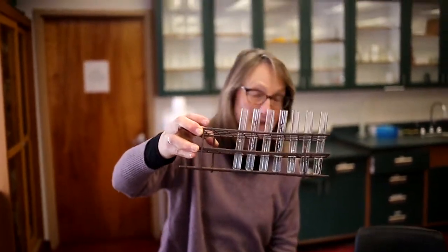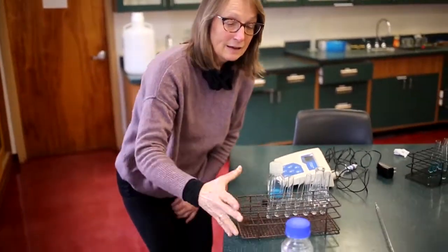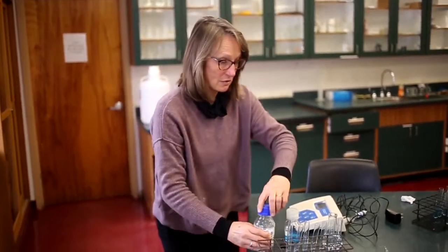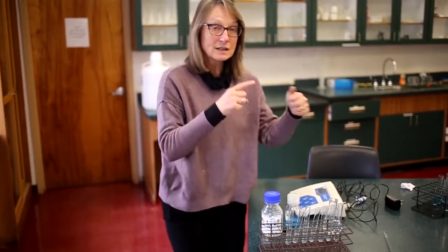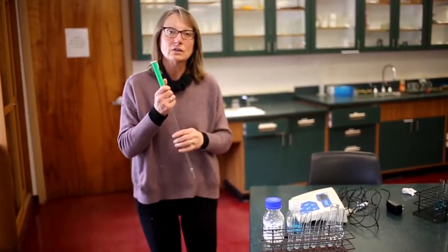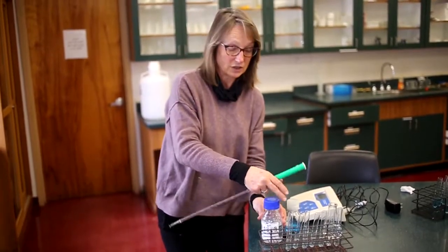But because of the chemistry of copper, when you add ammonia to it, and I've got some really smelly ammonia here, we're going to add 1 milliliter of ammonia to each of these tubes and let it mix up. We're going to see that the two complex with each other, the copper and the ammonia, and it's going to create a really pretty kind of cobalt blue color. And we're going to see that this is kind of a trick that you could create a test that's really, really sensitive for measuring copper concentrations in solutions.